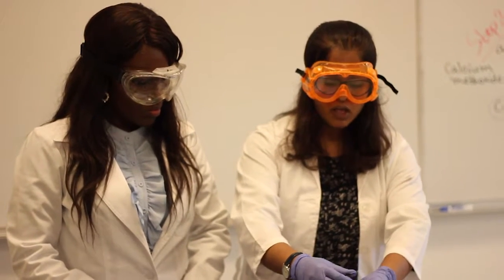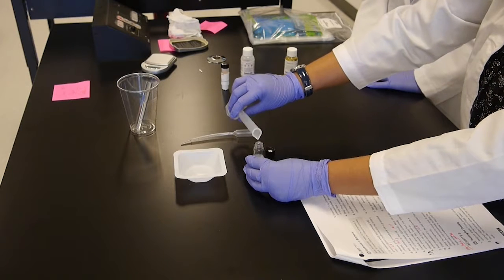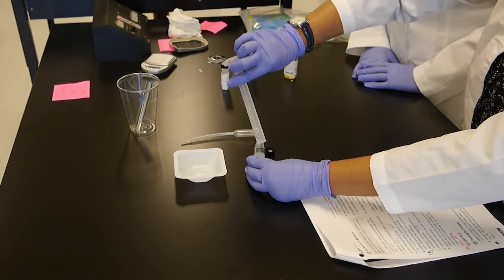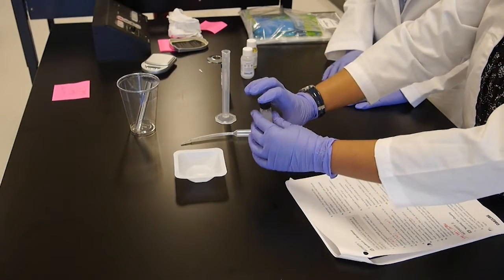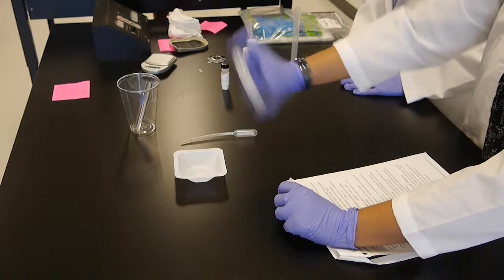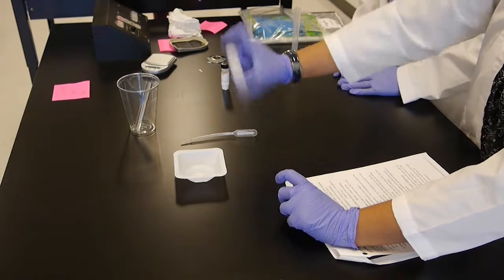You have to be careful. Keep it away because pressure might build up. Then we add 1 ml of vegetable oil to it. So this will be the last step. You have to wait for 48 hours. Before that, make sure to vigorously shake it again. Mix it well. We will be back in 48 hours.